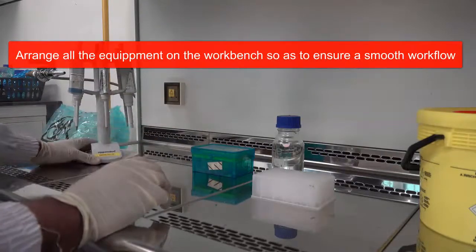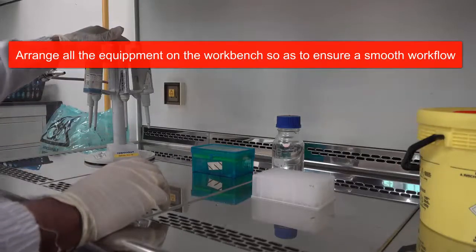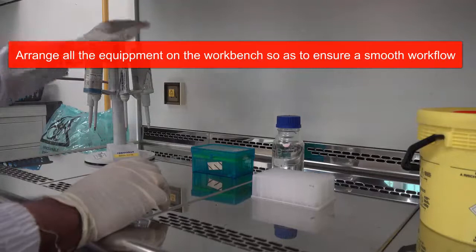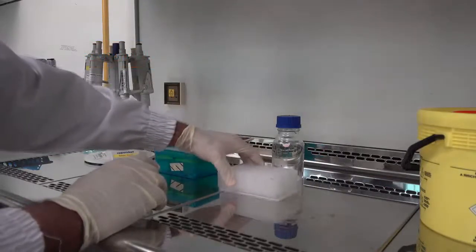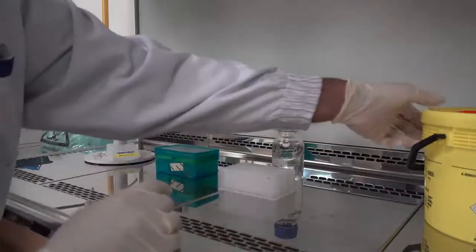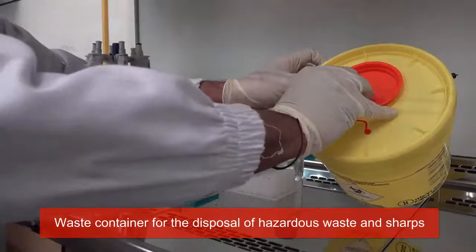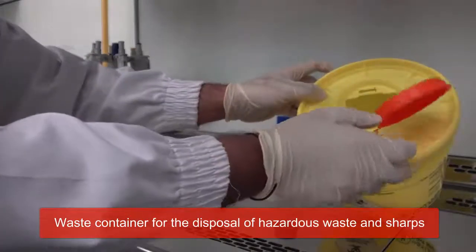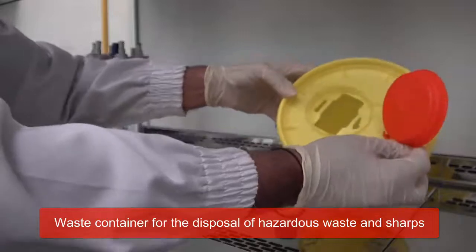These are the pipettes which are required for dispensing the samples which are located at this end. These are my pipette tips. This is the sample which will be transferred and finally over here I have the waste container.